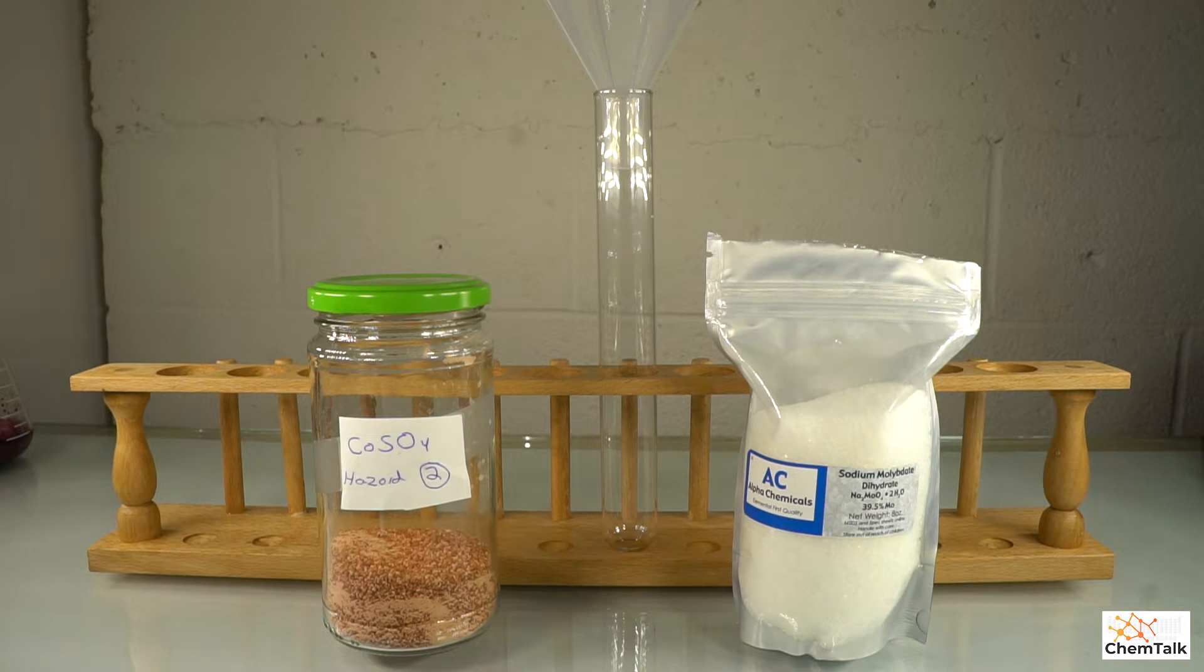It's going to form a beautiful precipitate, and this really shows why chemistry can be so fun and amazing, especially when you're using transition metal compounds and forming beautifully colored precipitates.